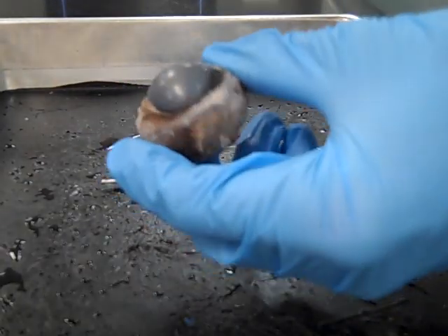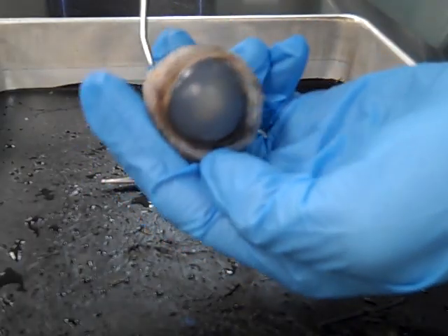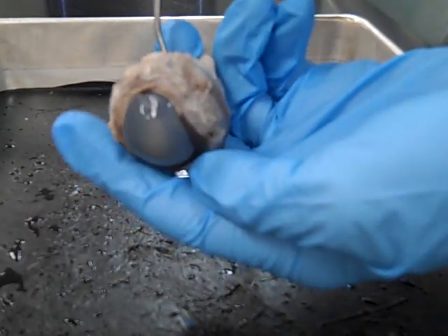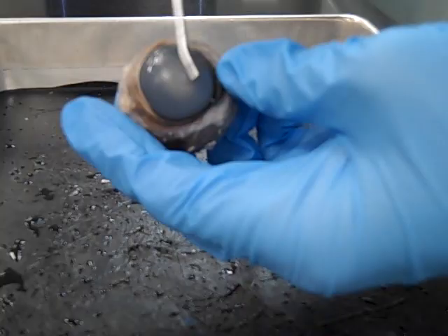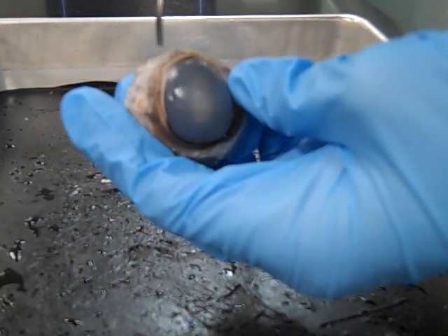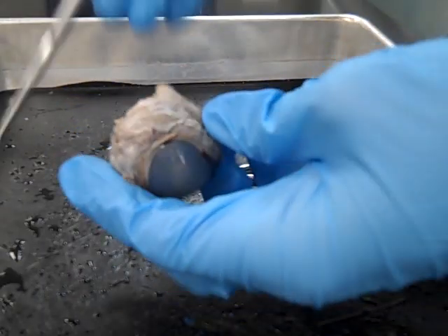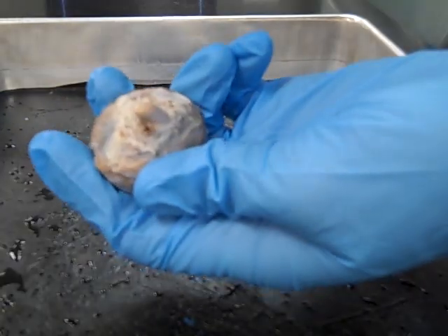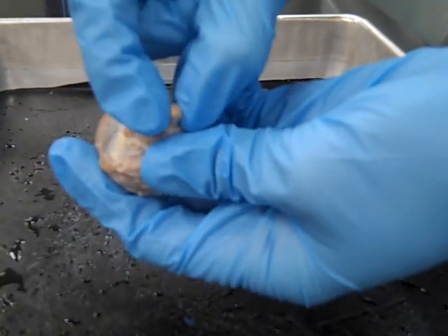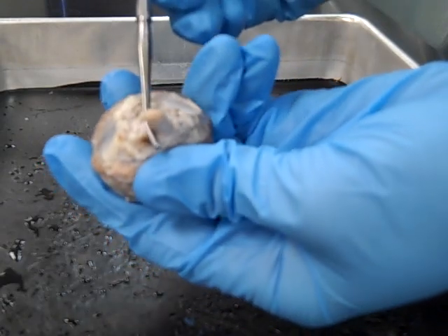On the outside of the eye we need to identify a few surfaces. All of this area around the circumference of the eye is the sclera. In front we have the cornea, and that's actually where we're going to make our first incision — right in between the cornea and the sclera. Before we check that out, let's flip the eyeball over to the back to notice the optic nerve, the remnant of the optic nerve.